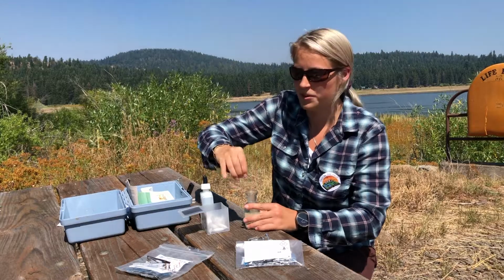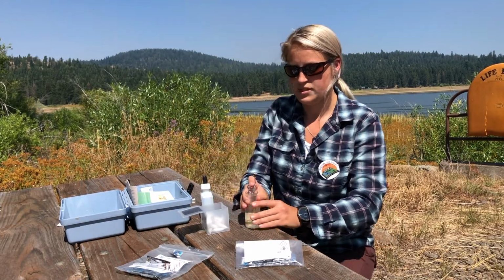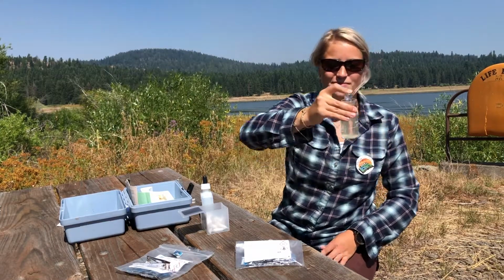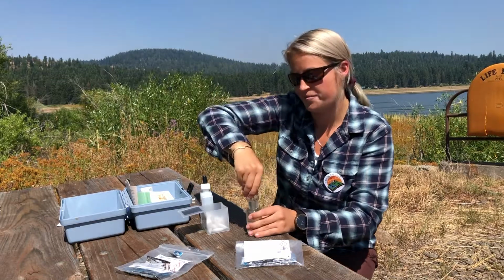Put my first sample. And then I'm going to shake it up. Okay. So not much has changed after our first chemical.